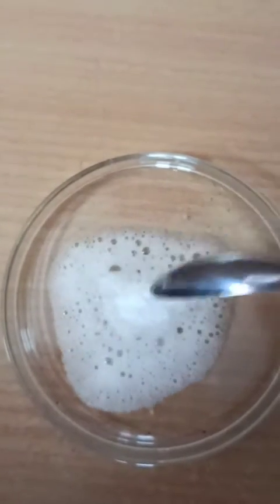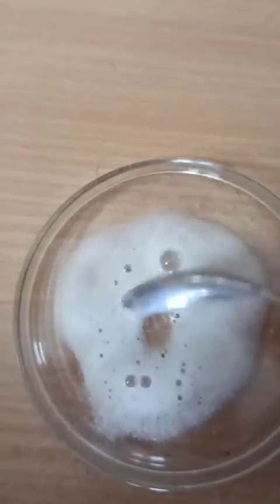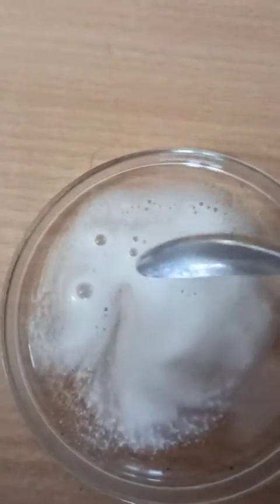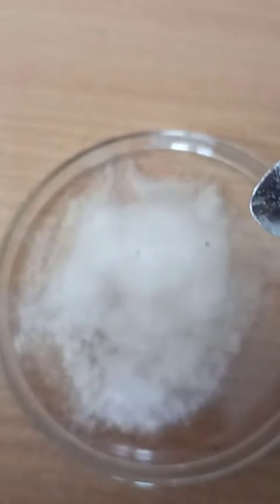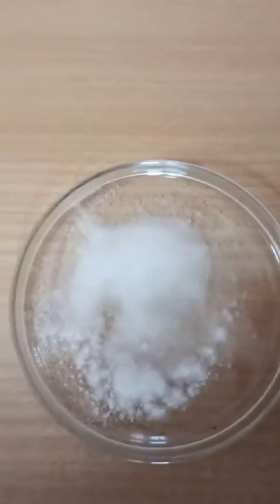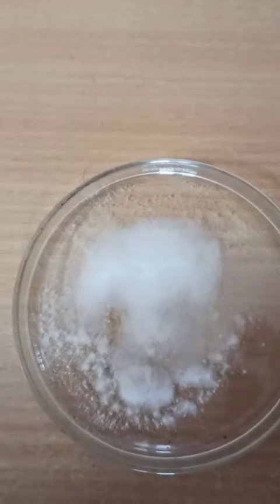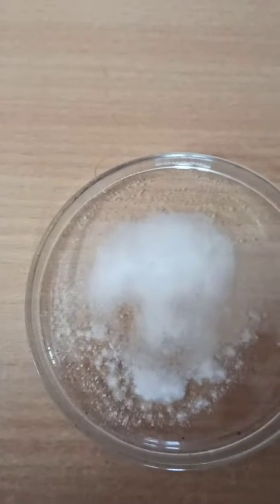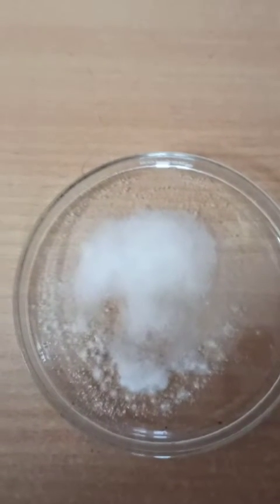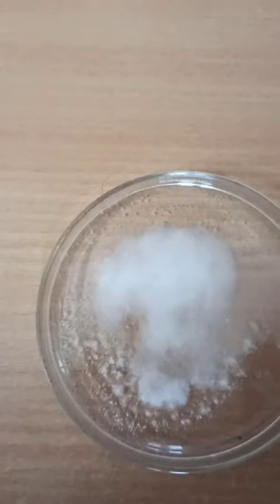Now children, this reaction is a neutralization reaction and it takes place immediately. You can see how bubbles are forming during this reaction. These bubbles show that there is evolution of some kind of gas.